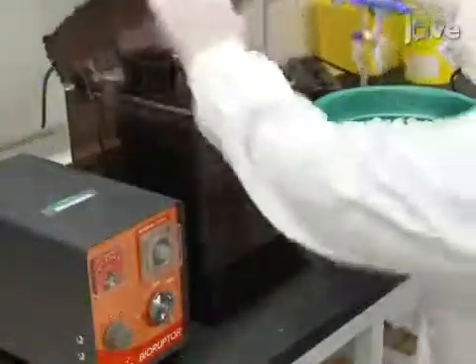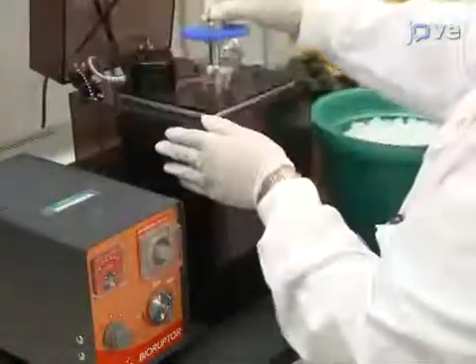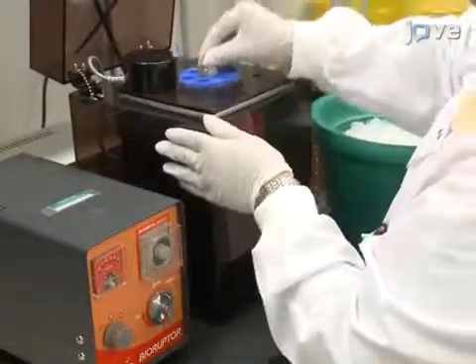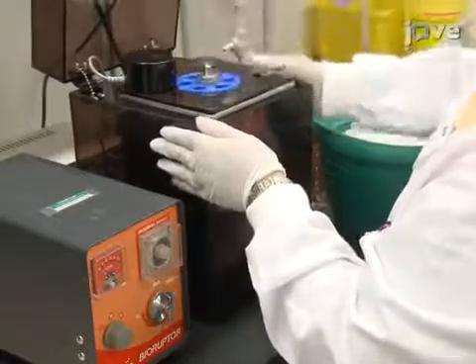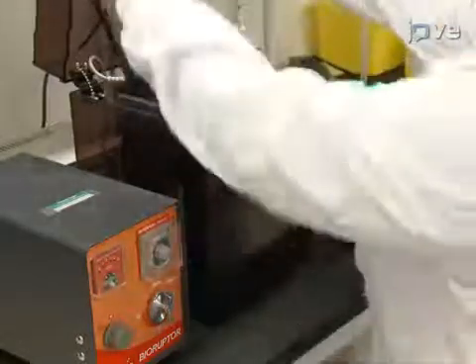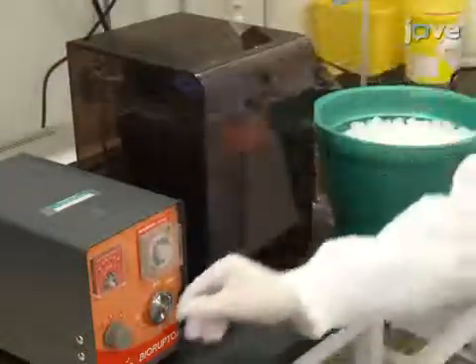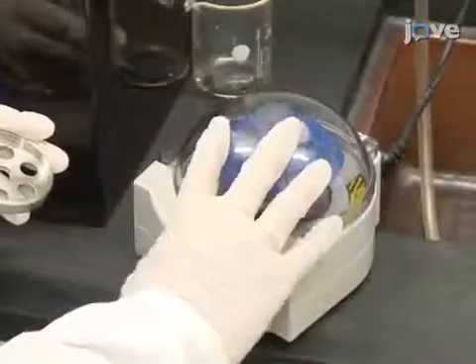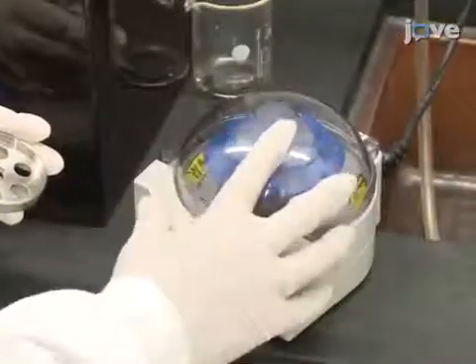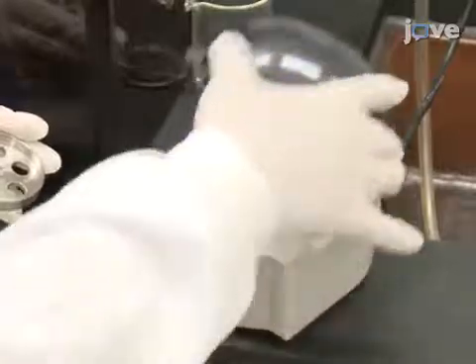Next, perform sonication in specially designed tubes using a sonicator for a total of 30 cycles of 30 seconds on and 30 seconds off. After every five cycles, briefly spin the tubes to collect the samples to the bottom.